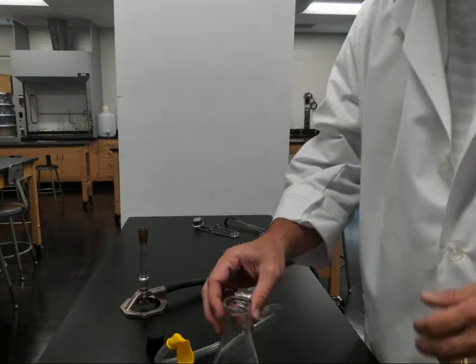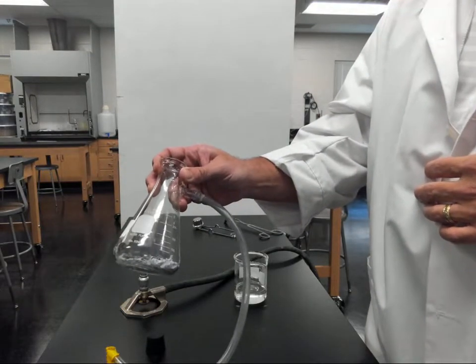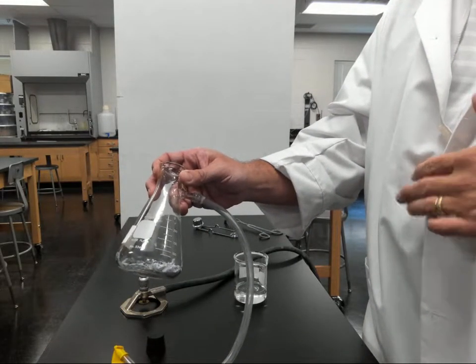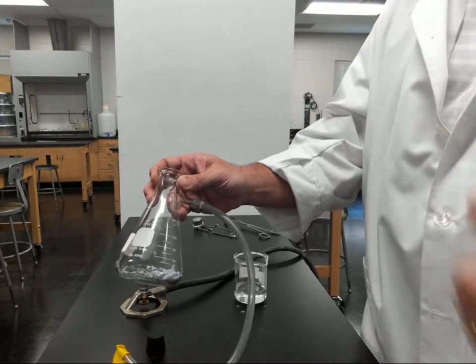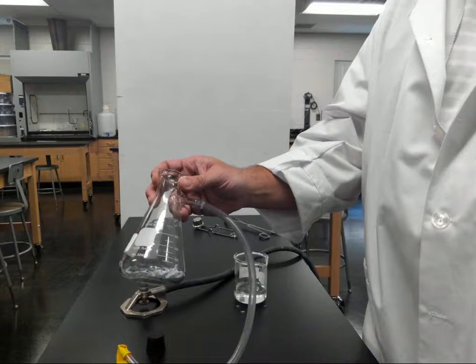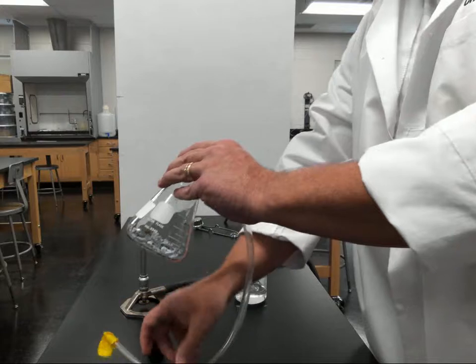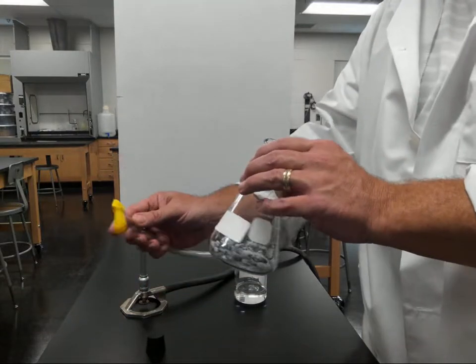In this reaction, we're going to be taking solid zinc and adding hydrochloric acid. This will be a redox reaction, an oxidation-reduction, sometimes known as a single replacement reaction. The zinc is going to go into solution, forcing the hydrogen that's in solution to come out.